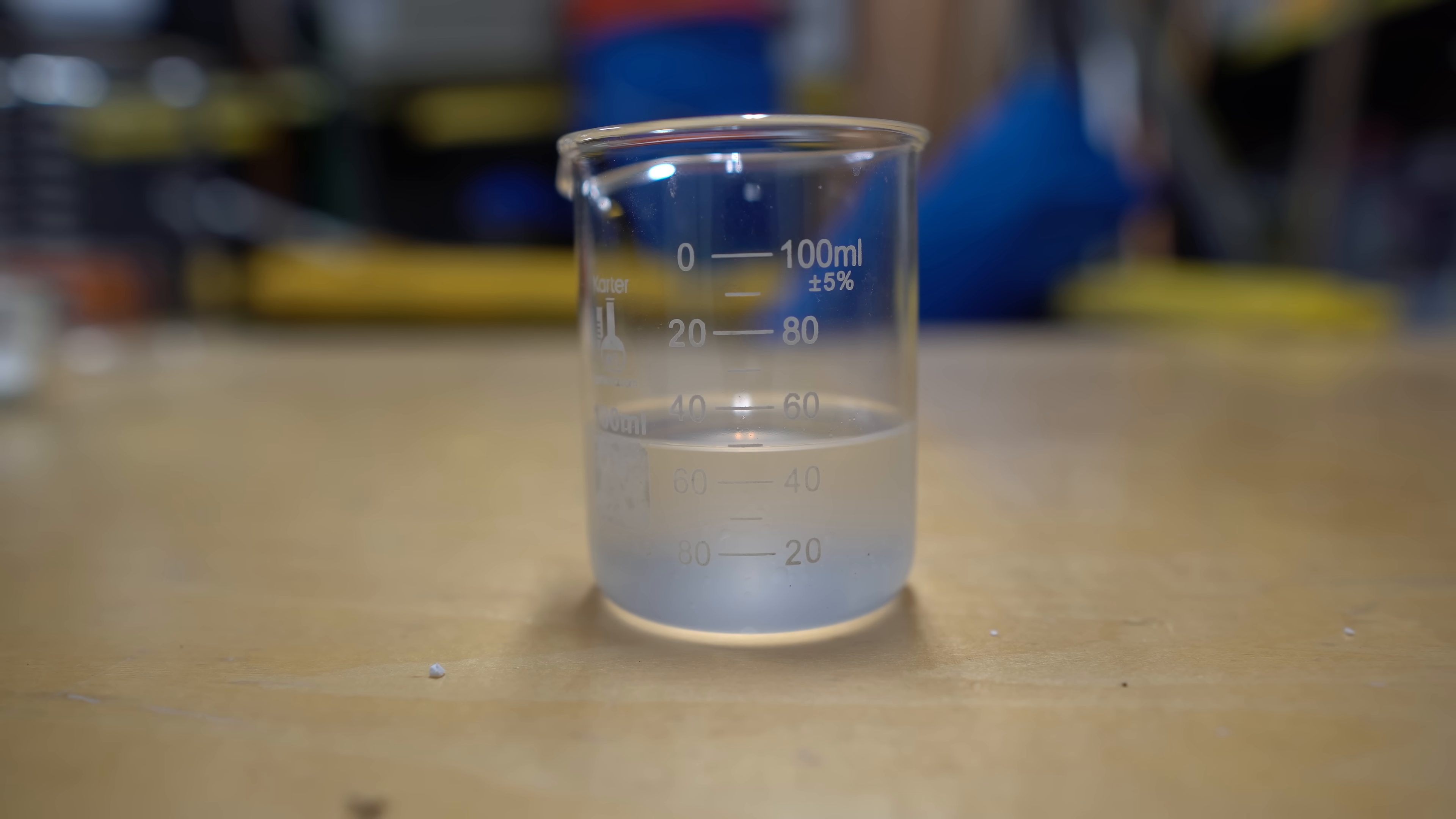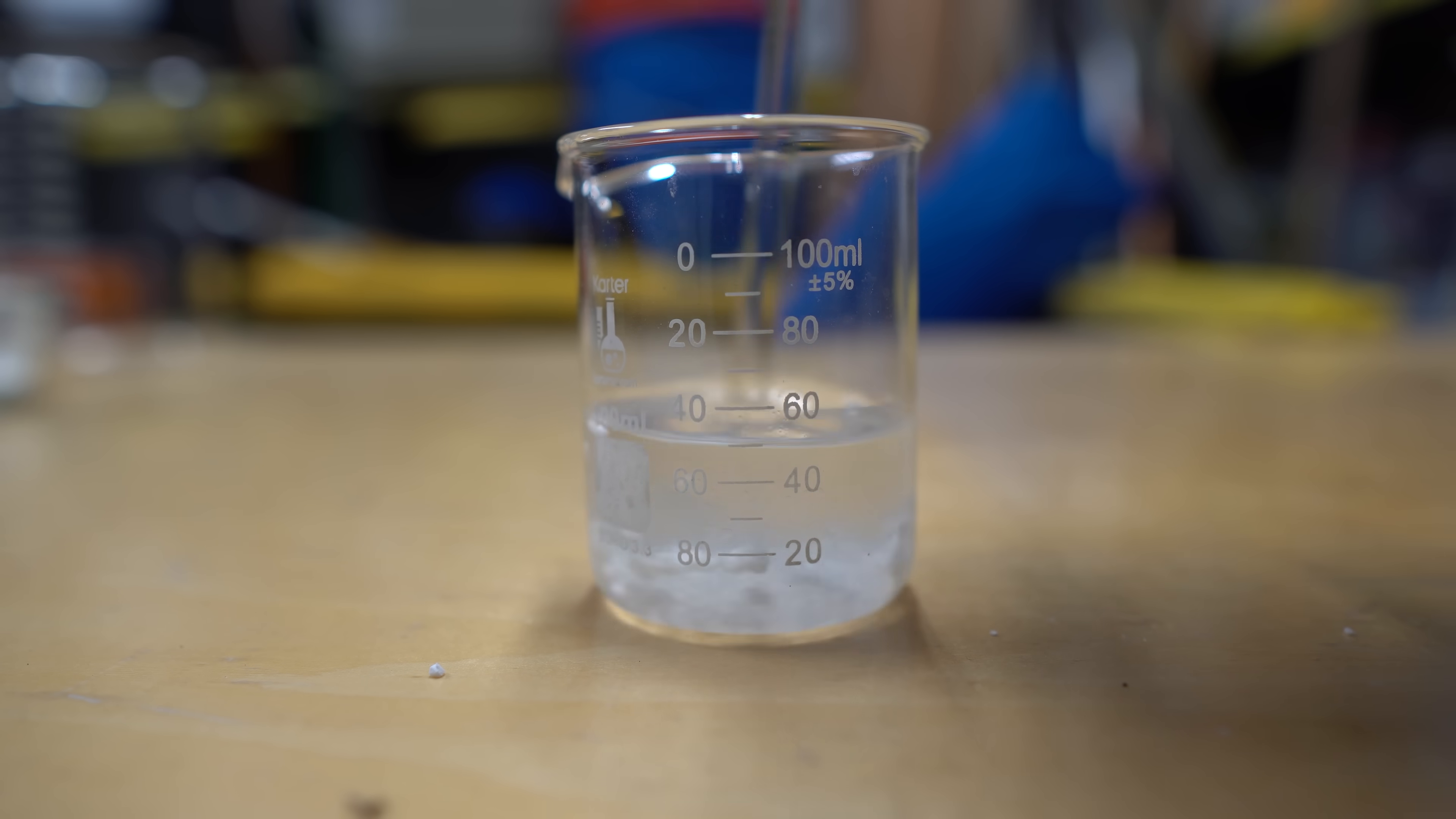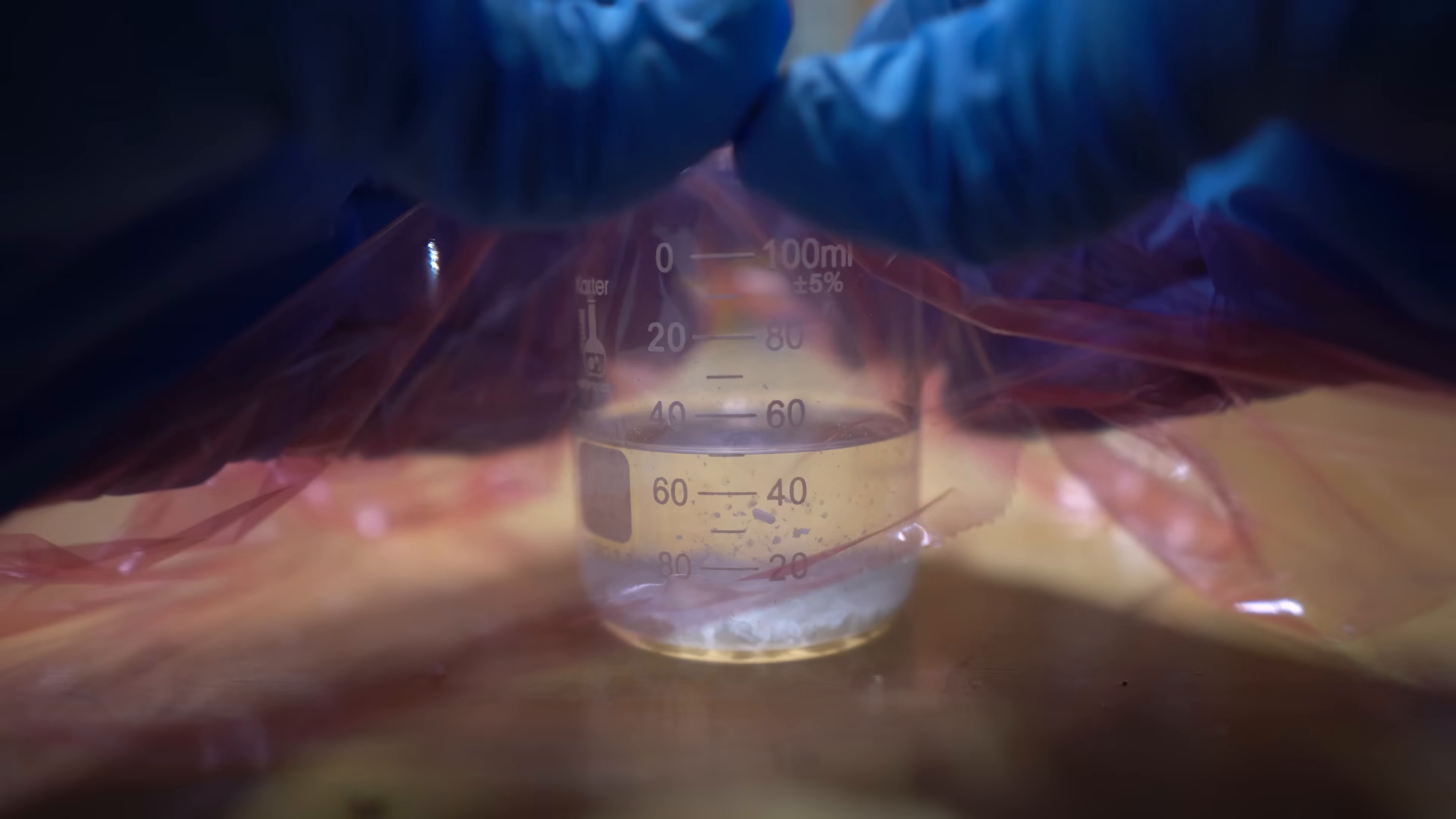We're now going to add the anhydrous magnesium sulfate that we made earlier, and we're going to dry out the chloroform just in case there's any water in there. It was then wrapped and set aside so I can actually show you what a reaction of 12 to 24 hours actually produces.